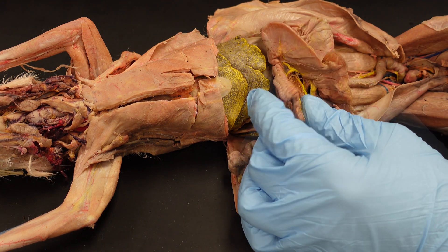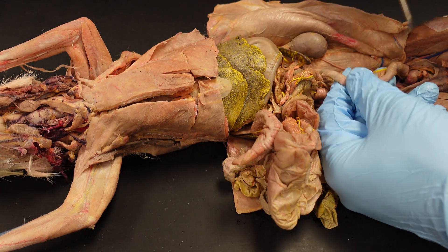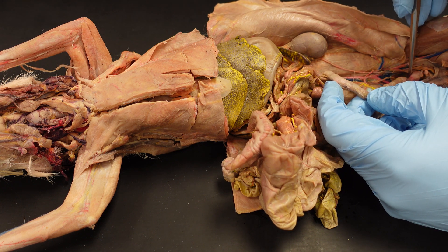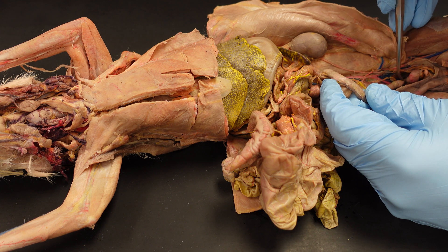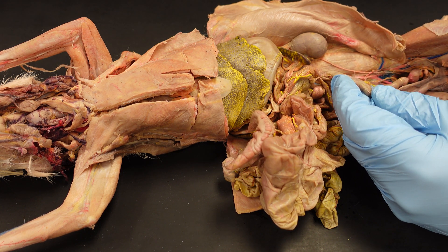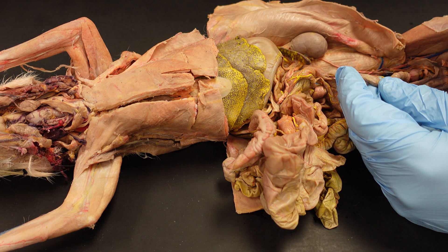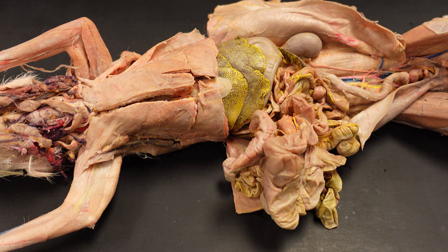At the end of the large intestine, you might see some little rabbit pellets, and down here we have the rectum. That actually covers all of the digestive system that we want you to learn for this unit. There will be a separate video on the liver. Take care everyone — see you in lab.